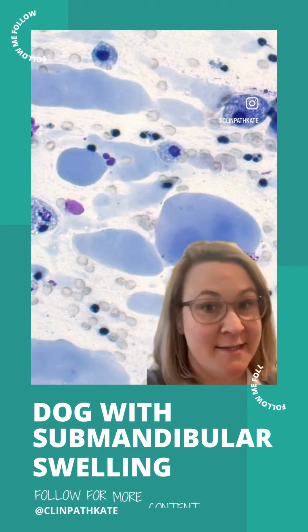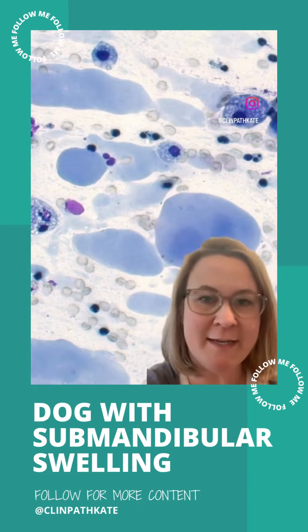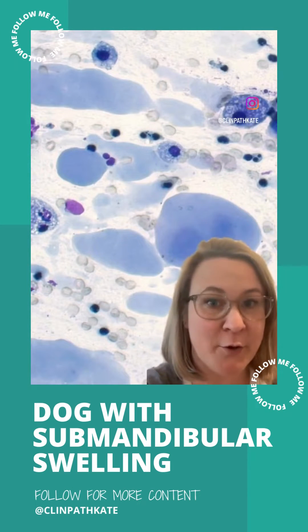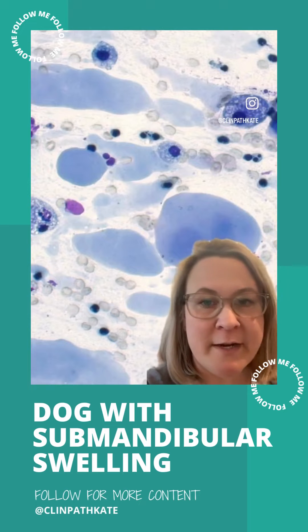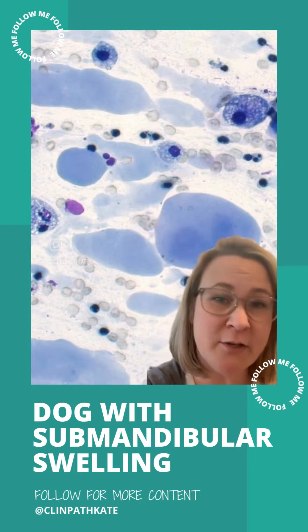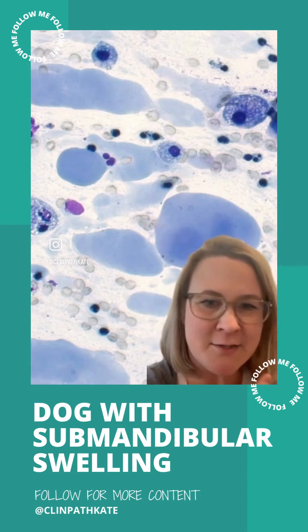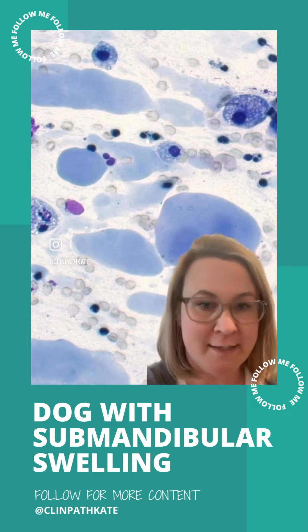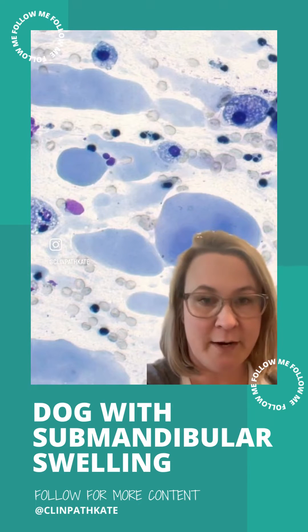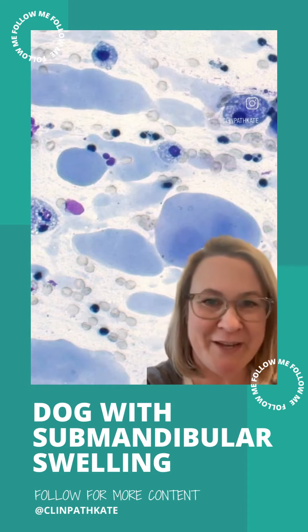Today's case is a 10-year-old dog that had a swelling in his neck area noted by his owners. He's brought into his veterinarian. The veterinarian took a look, and sure enough, there was this nondiscrete, fluctuant swelling in his submandibular area, which they aspirated, and that's what we're looking at.